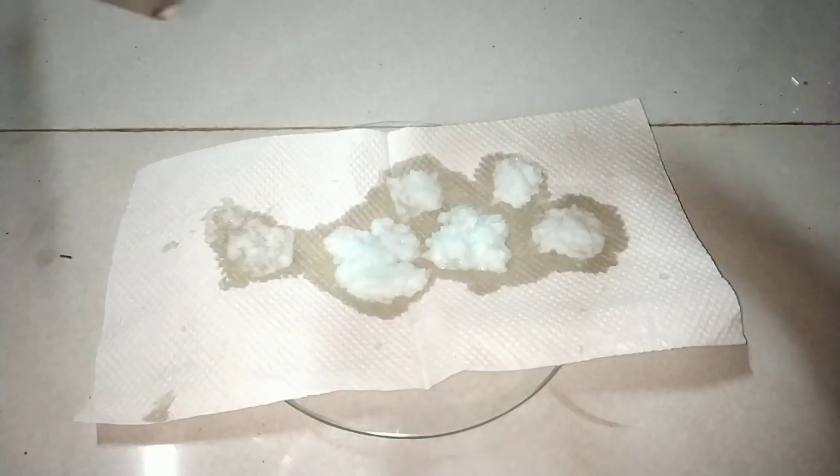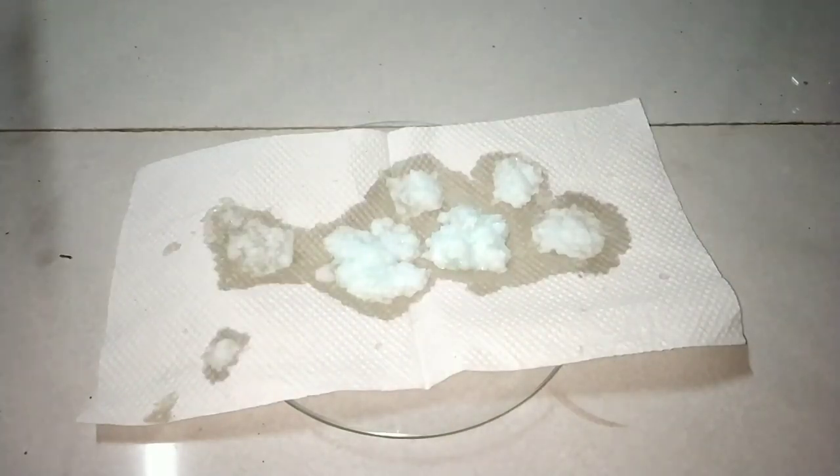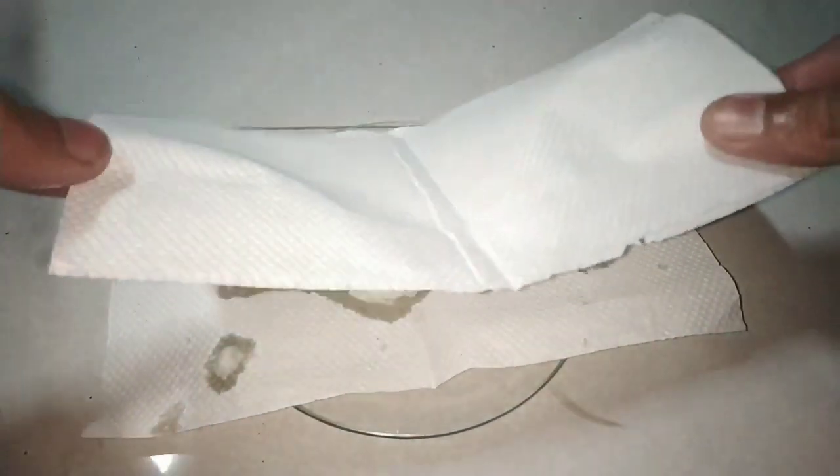For me right now this is enough. I am not planning to recrystallize more. When I plan to do the Tollens test then during that time I may recrystallize.